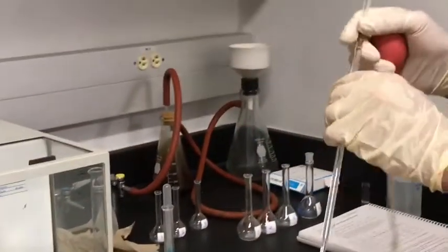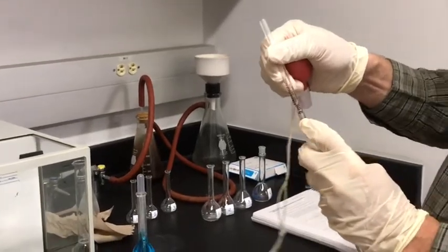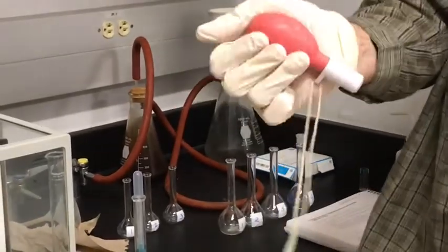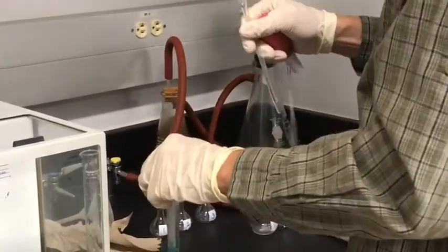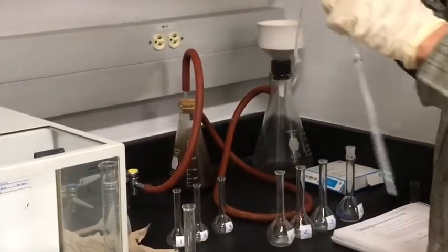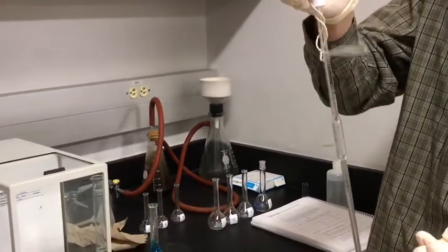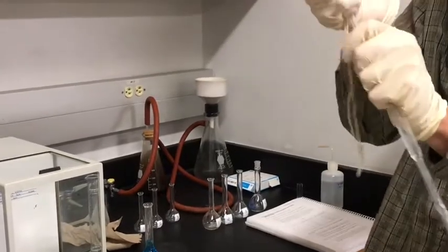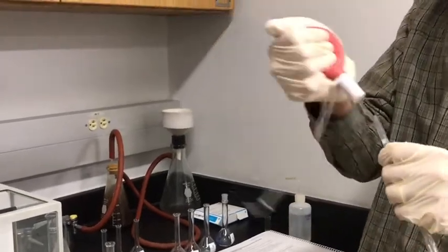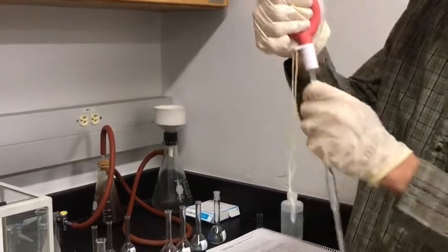So we take our 5 ml volumetric pipette. These have a marking here where it's at 5 milliliters. This is a pipette bulb. Let me get this out of the way. When you use a pipette, never force it down on the bulb so the pipette is hanging from it. That is not the way to use these. You will squeeze the bulb and apply only enough pressure to create a seal there, but don't force it right on there.